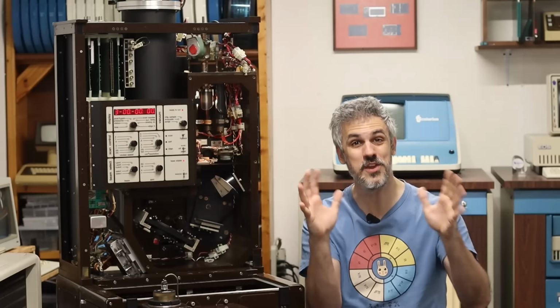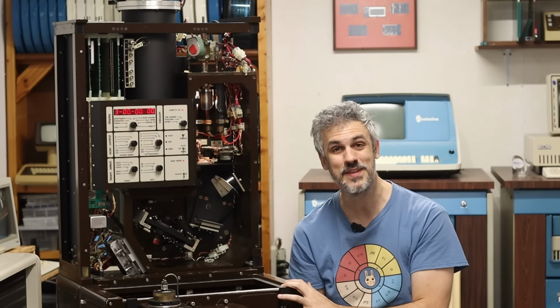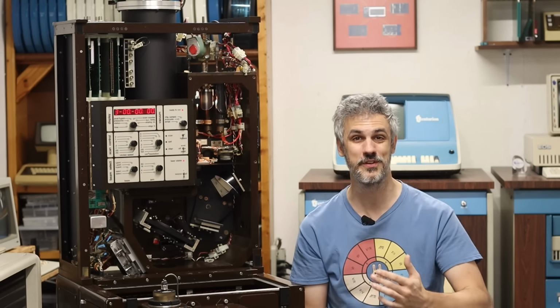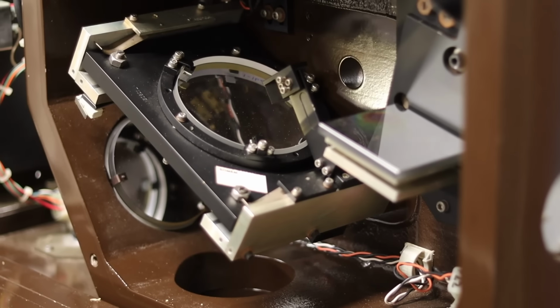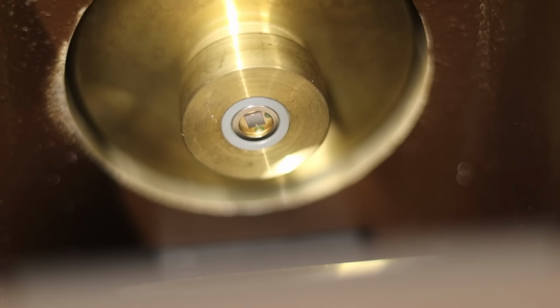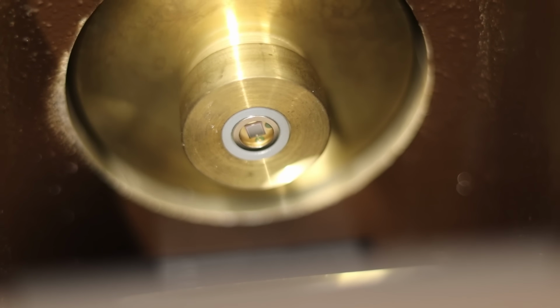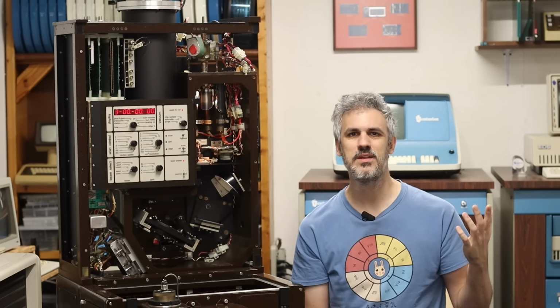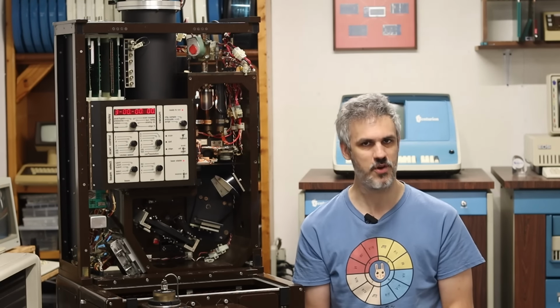So Mike, thank you so much for letting me get my hands on this, but also thank you for just walking me through everything that's involved with this field. It's absolutely fascinating. Also, Mike, I think we're gonna pay you a visit here in a little bit because there are some things that I wanna check on your Bomem that you have in your home lab. But first things first, what is a spectrometer and what is spectroscopy?